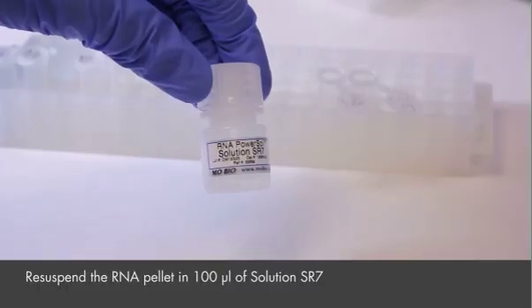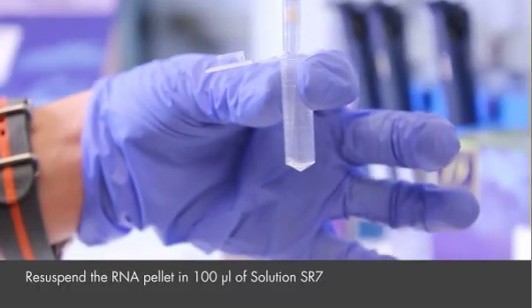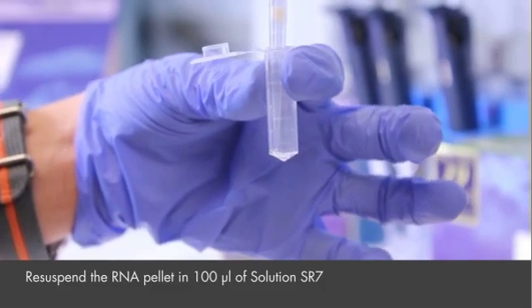Once the pellet is completely dry, re-suspend it in 100 microliters of solution SR7. Your RNA is ready for analysis and sequencing.